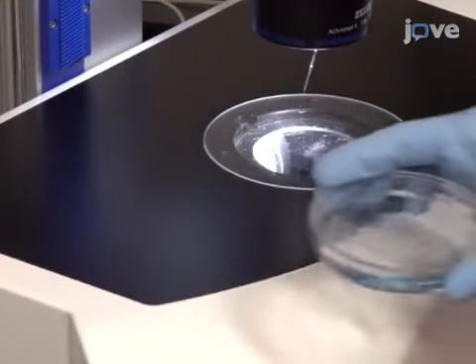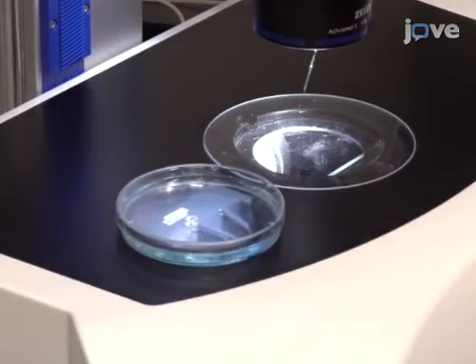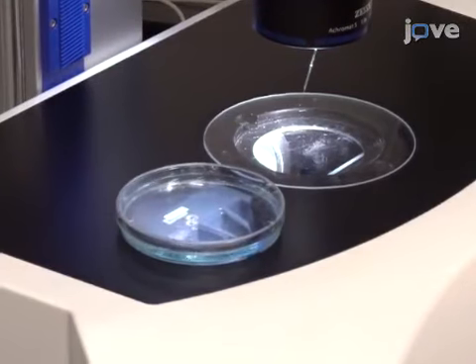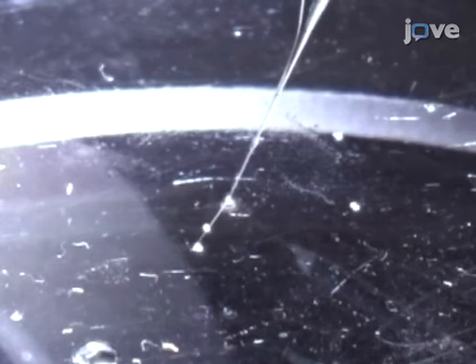After preparing zebrafish embryos as well as microinjection needles with morpholinos or mRNA according to the text protocol, immerse the needle tip in a drop of mineral oil in a dish.